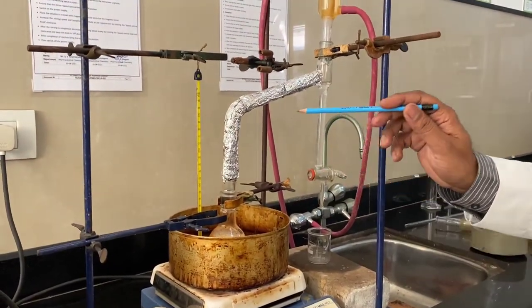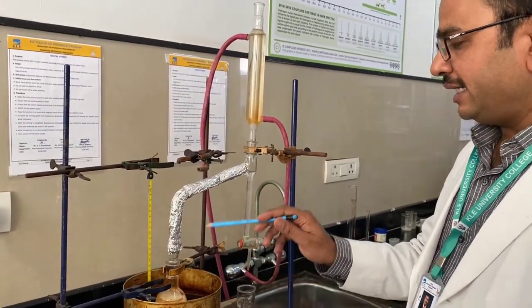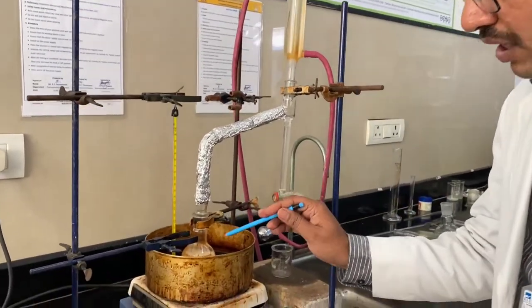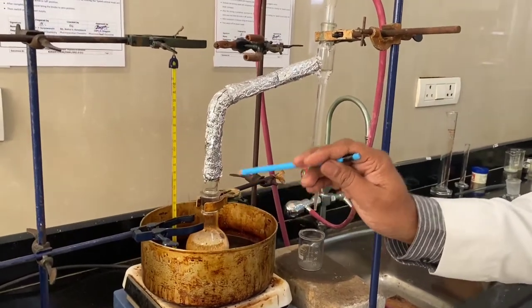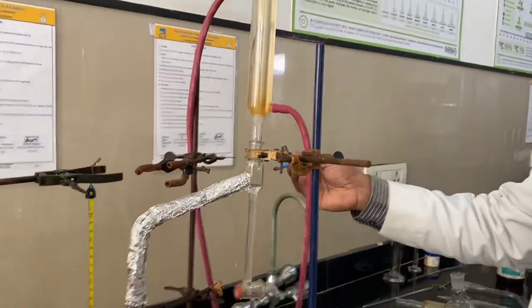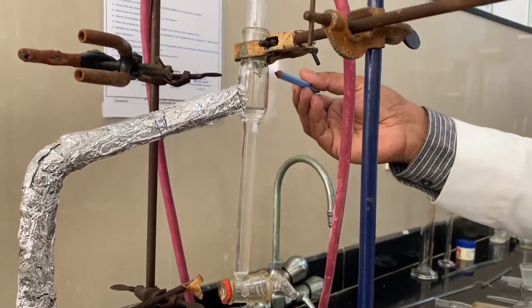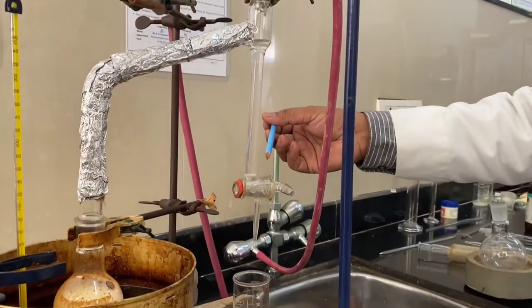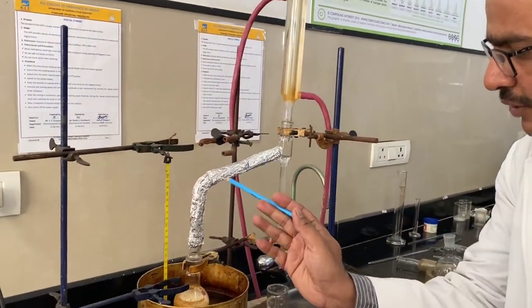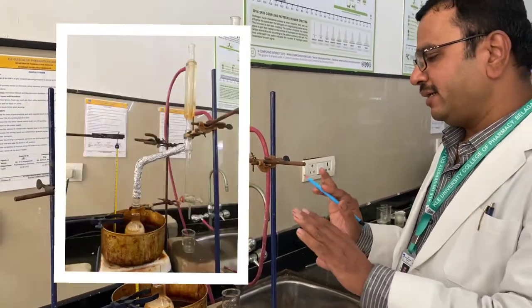In the reaction mixture, water is prepared as a by-product. That water is going to be removed from the reaction. The water and whatever azeotropic solvent — like toluene — will go azeotropically up into the condenser and condense. The water is going to come down because its density is more than toluene, and toluene will once again go back to the reaction mixture. This is the simple setup of the Dean-Stark Apparatus.